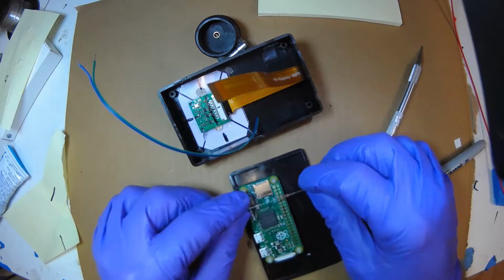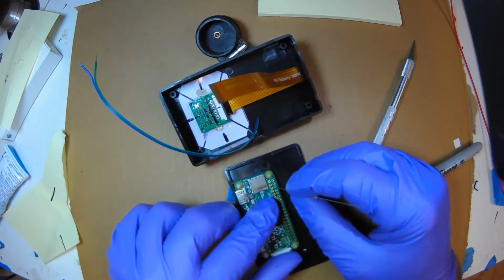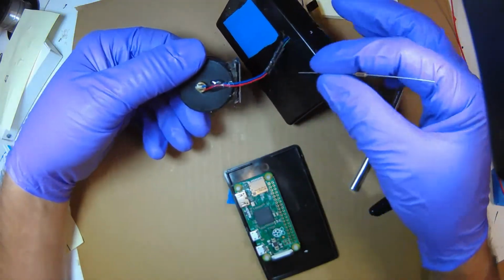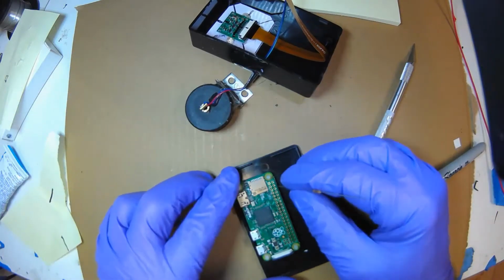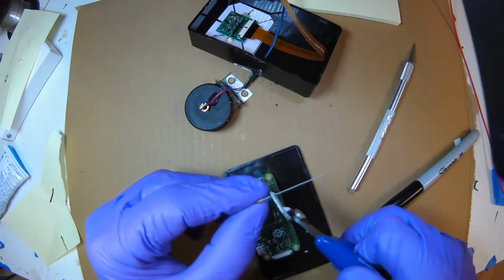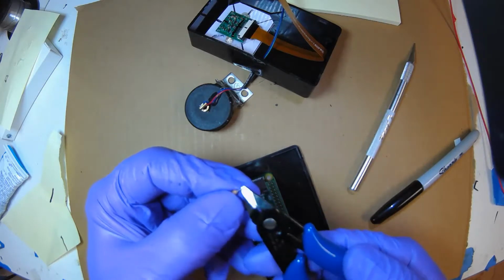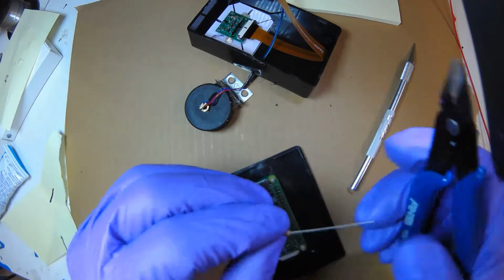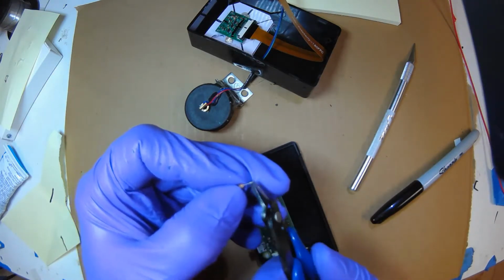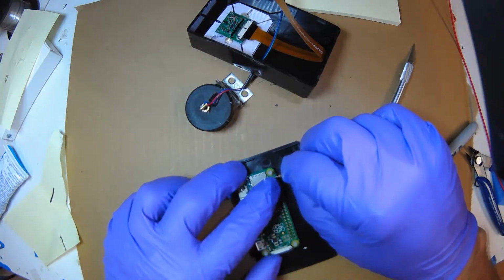So what I'm going to do is I'm going to attach the resistor to the first hole, and then hook the ground wire. Let's see, on this, the blue is the ground wire to the ground. So I'm going to trim this, and I'm going to make a right angle by holding on and bending it. See the right angle? And I'll cut this one, and I'm going to make a full loop. There's the loop.